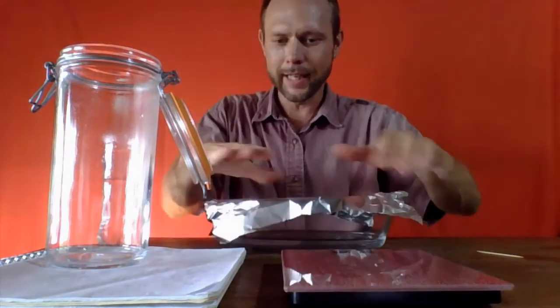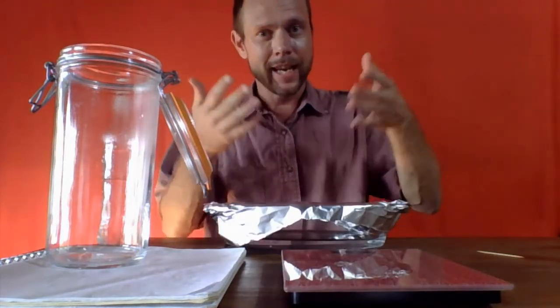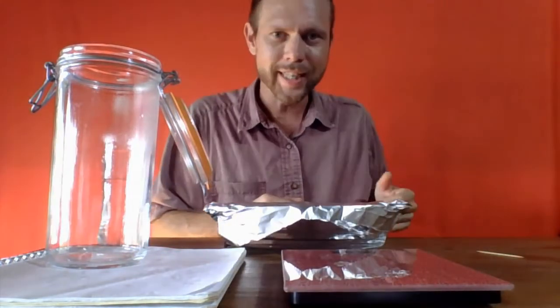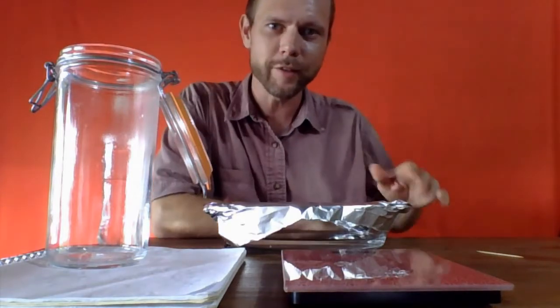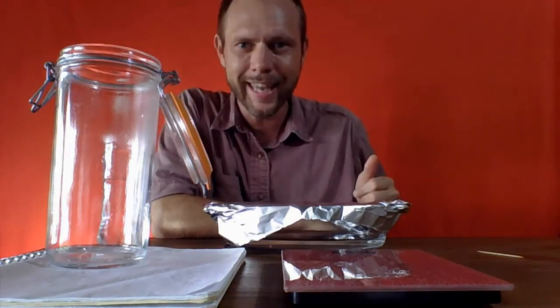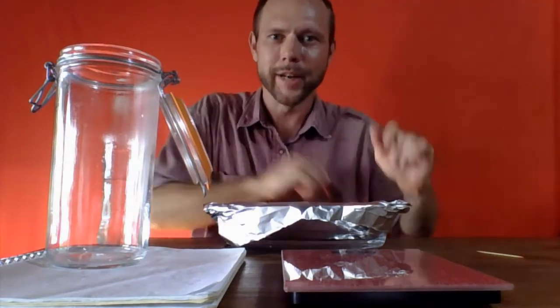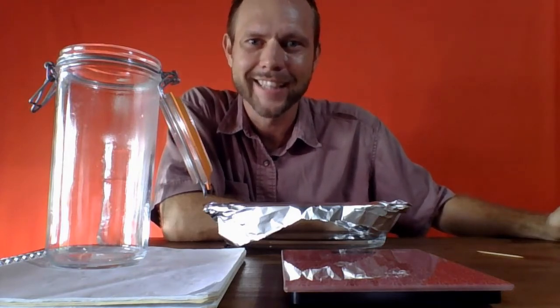I'm going to put the lid back on, and again, it was 938 grams empty. We could weigh it right now to get a sense of how much water we have, but it doesn't really matter. The idea here is that I want to cook off all this water and then weigh it again after we are baking. So I'm going to take this over to the oven, and we're going to watch it cook for a minute before we take our next measurement.